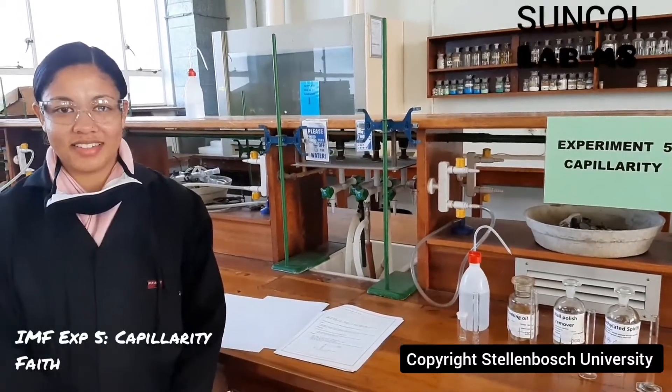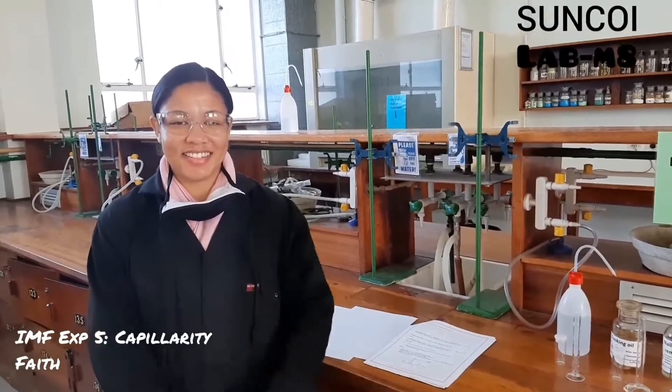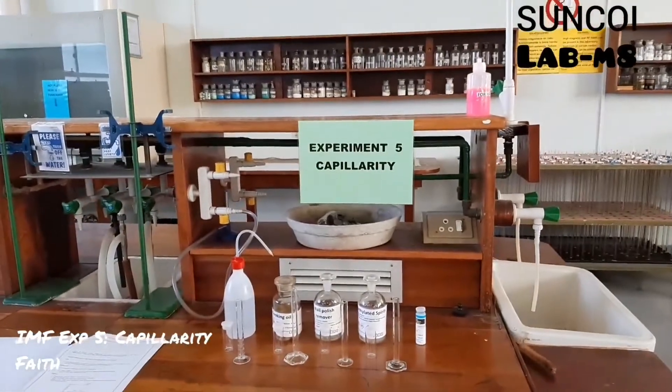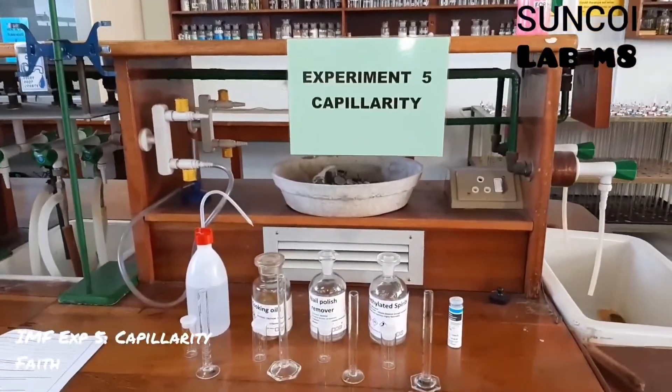Okay guys, so this is Faith and she is going to be your lab mate for today and we are going to do experiment 5 of intermolecular forces which is capillarity.